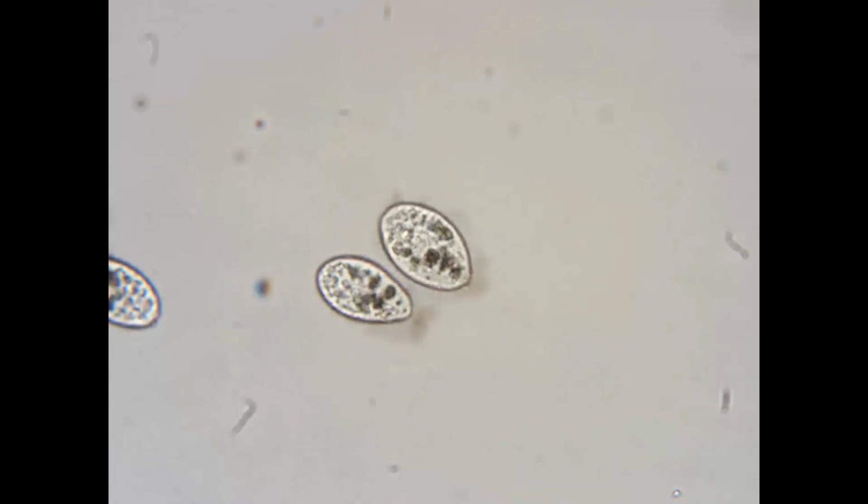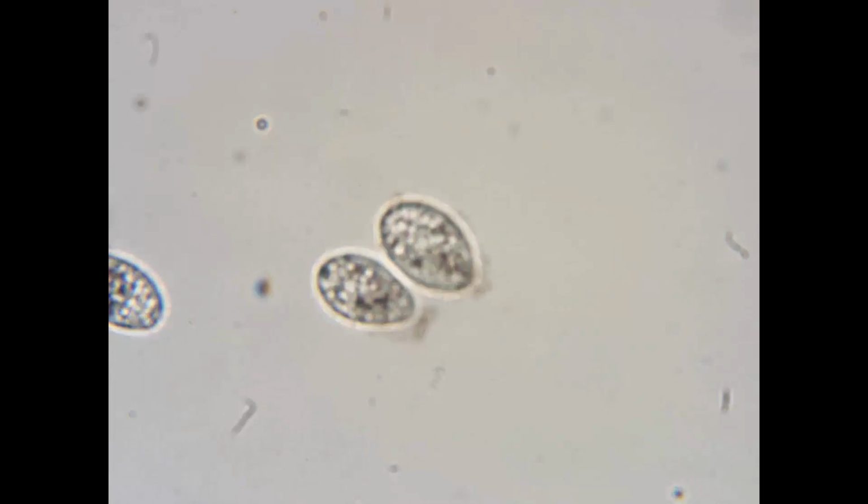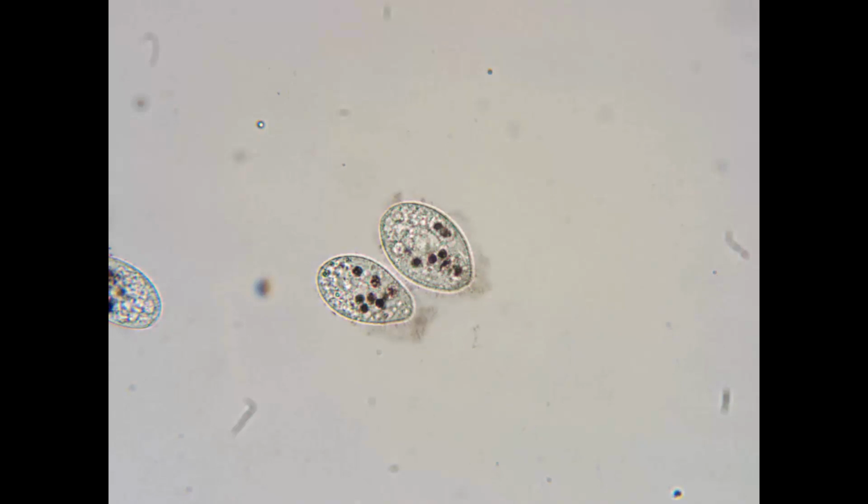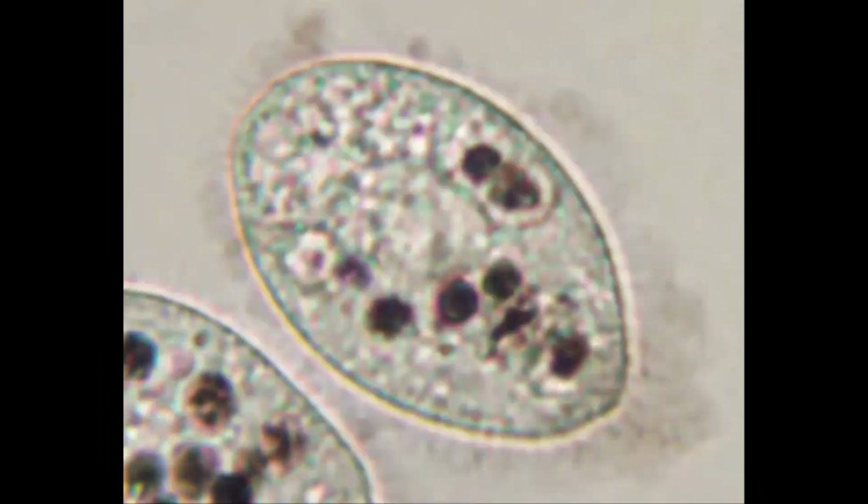It's important to remember the tetrahymena are 3-dimensional, so different parts will be in focus at different times. I'm trying to find a nice focus where all the vacuoles can be seen. This looks pretty good. Let me take a picture, crop the cell, and digitally enlarge on the screen. Now it's time to count the vacuoles. I would say there are 8 in this cell.